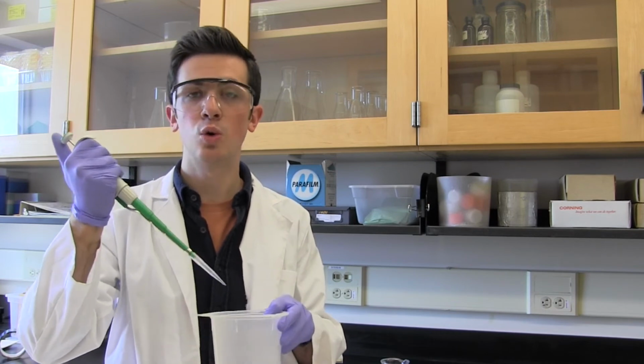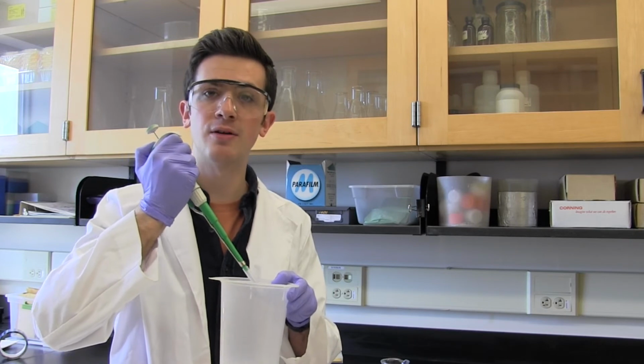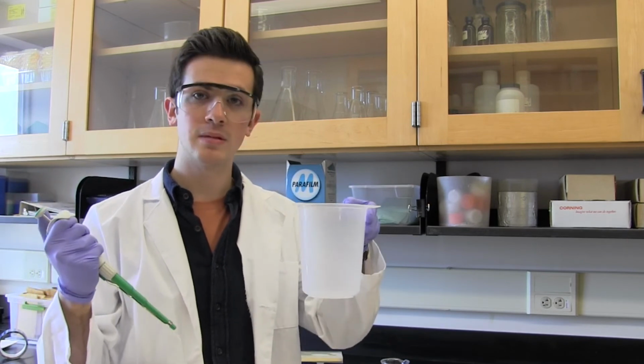Don't use pipette tips in more than just one solution. Only use it in one solution before changing the tip to use in other solutions or other liquids. Again, failing to do this could introduce sources of cross-contamination. When you're done with the pipette tip, there should be some sort of container lying around for you to put your used tips in. Simply depress the ejector and it'll release the pipette tip into the basin.